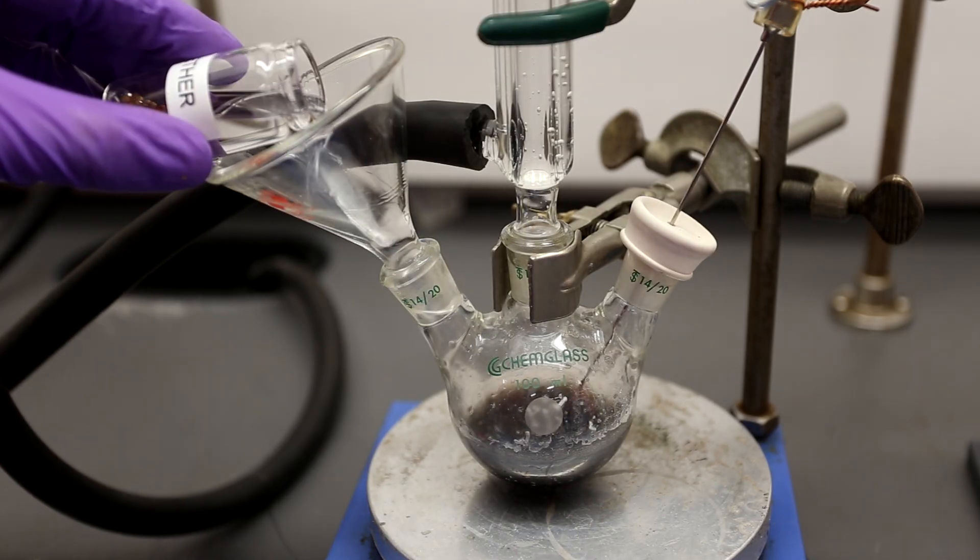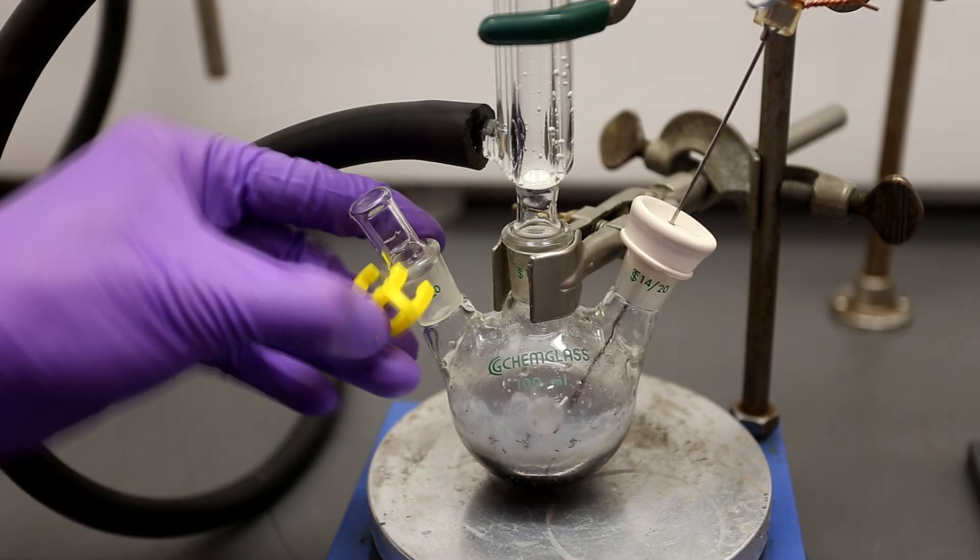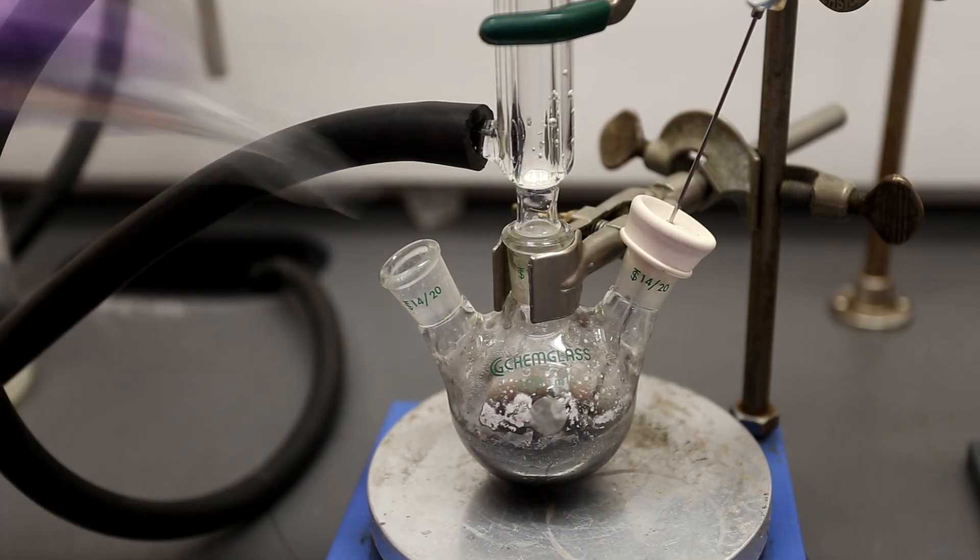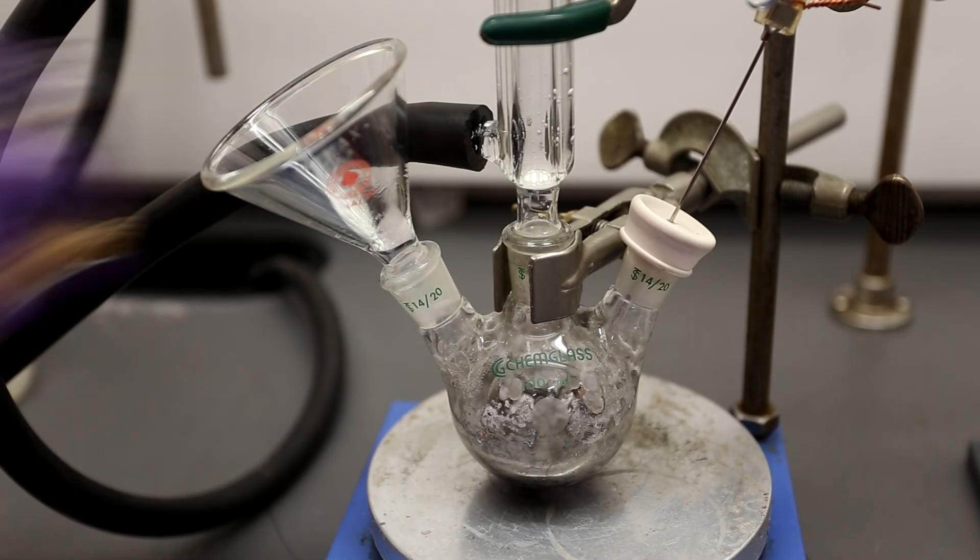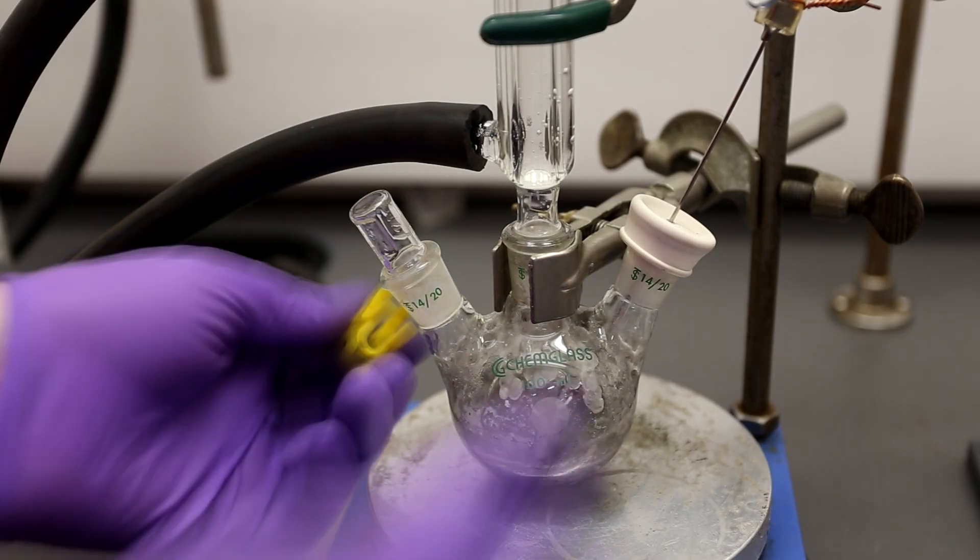As CO2 is bubbled through the solution, there will be a loss of ether, so you're going to have to replenish it several times. Bubble the CO2 through the solution for 15 minutes at least.